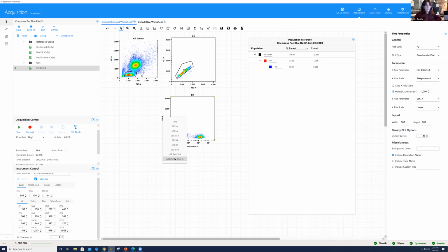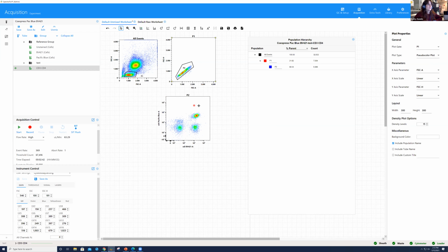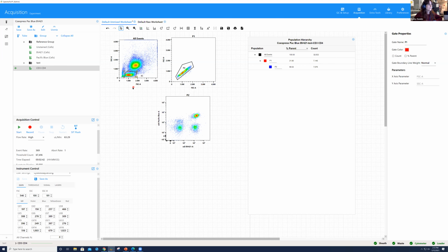And when we click on that, this is where I have the drum roll from either Rui or Derek. We see that it does pop up, right? Thank you. So this is an example here that we wanted to show in case people had a little bit of a doubt as to whether or not this is a possible combination on markers that you know are co-expressed. So we do see that you have your CD3 single positive, we have our CD4, CD3 double positive, and then you also have this dim CD4, which is likely some monocytes that are still in this scatter gate, right? So that is the example of how you can combine these fluorochromes even though the markers are co-expressed.